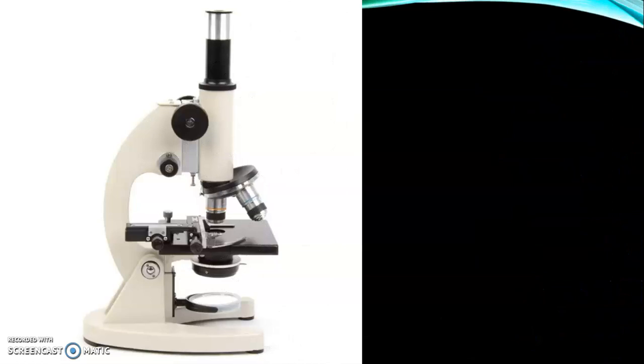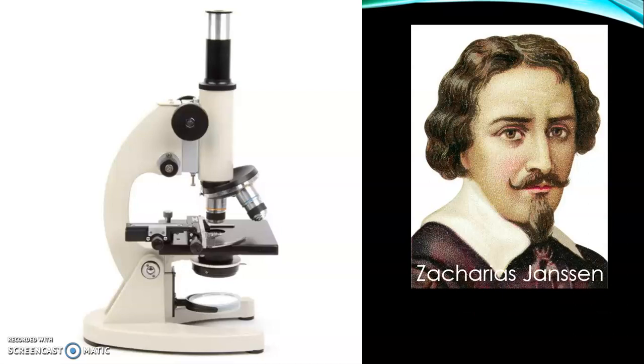Every major field of science has benefited from the use of some form of microscope, an invention that dates back to the late 16th century and the modest Dutch eyeglasses maker named Zacharias Jansen.